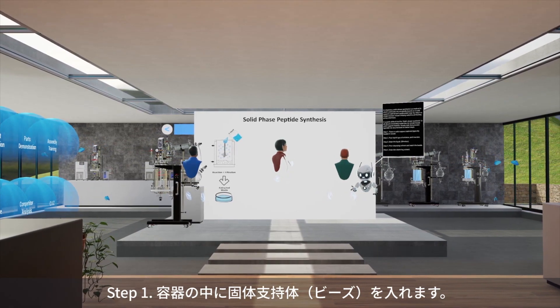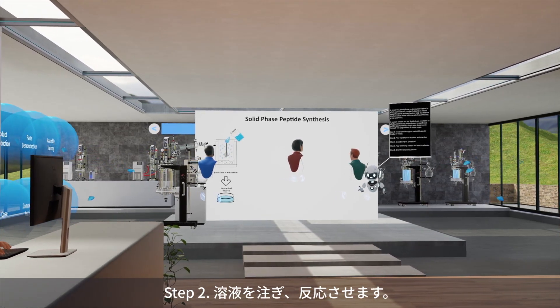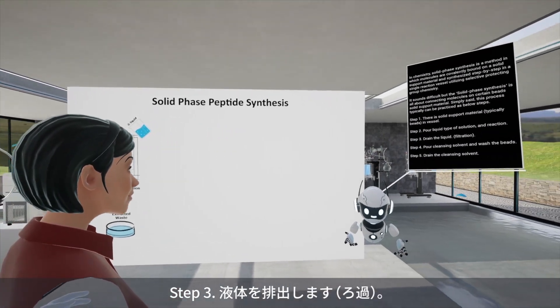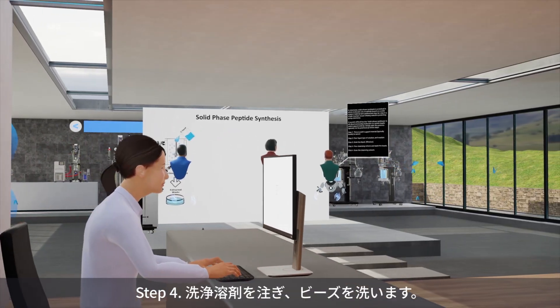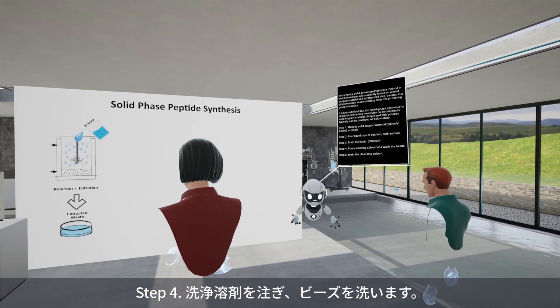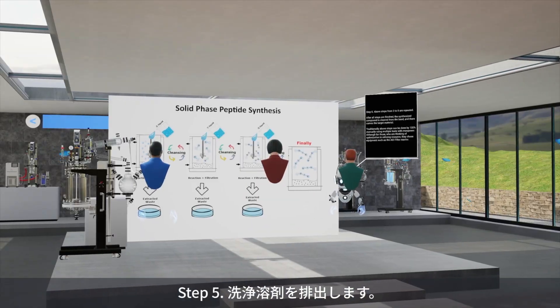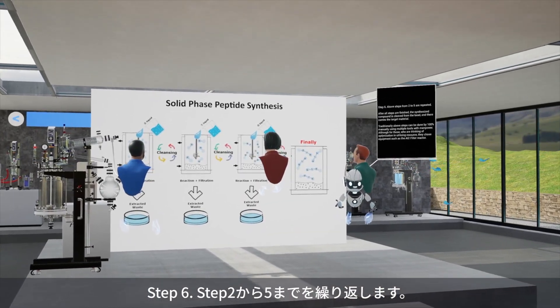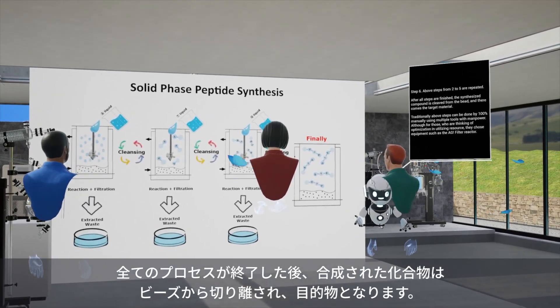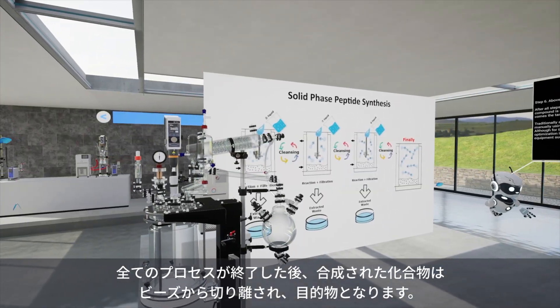Step 1: There is solid support material, typically beads, in the vessel. Step 2: Pour liquid type of solution and reaction. Step 3: Drain the liquid — filtration. Step 4: Pour cleansing solvent and wash the beads. Step 5: Drain the cleansing solvent. Step 6: Above steps from 2 to 5 are repeated. After all steps are finished, the synthesized compound is cleaved from the bead, and there comes the target material.